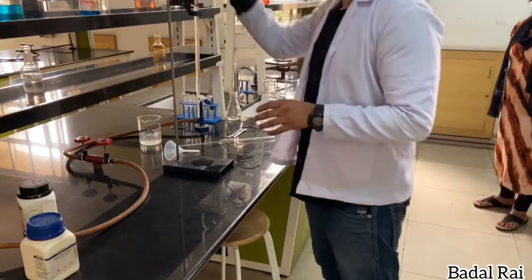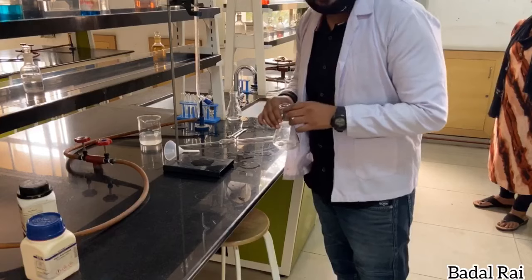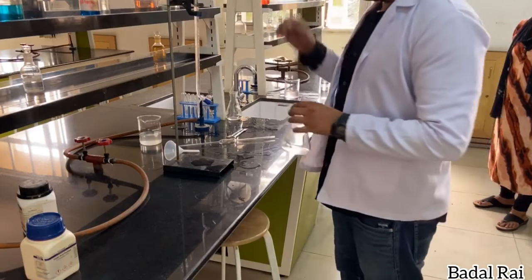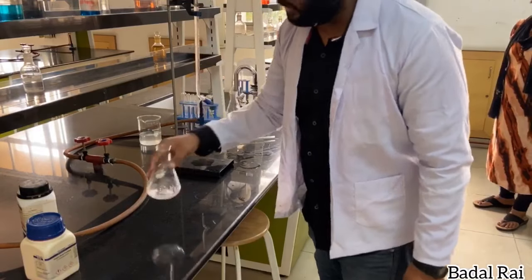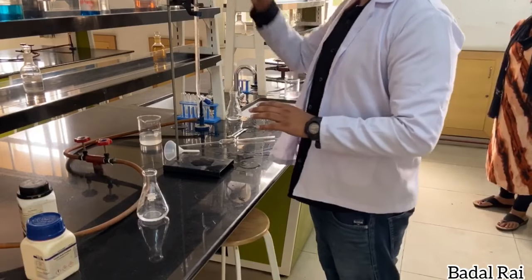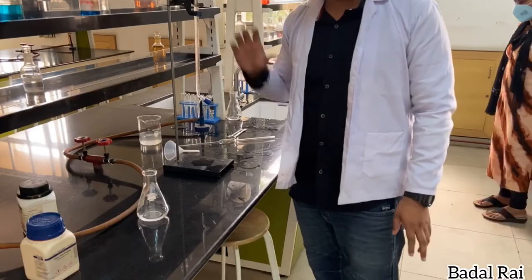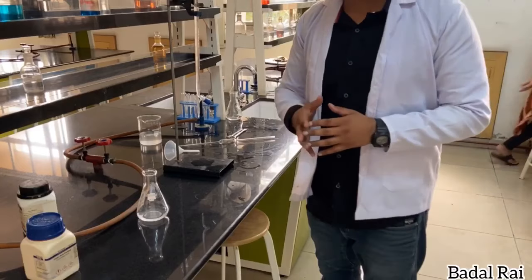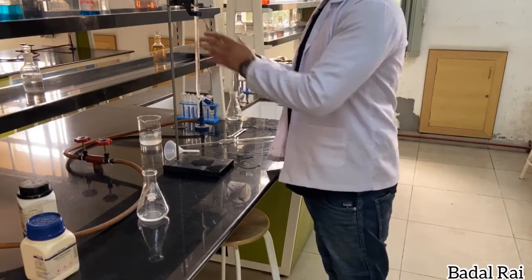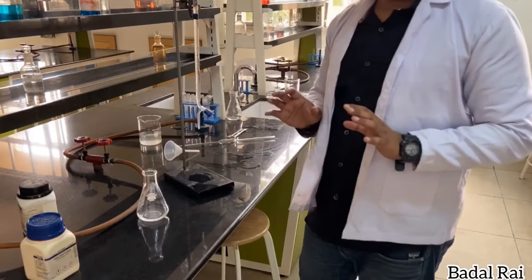We need to stop and note the reading. The initial reading was 0.1, and the final reading is 10, so the volume used is 10 minus 0.1. We need to perform at least 3 readings and take the mean. We will record the volume used and then explain the calculations for the titration between oxalic acid and NaOH.